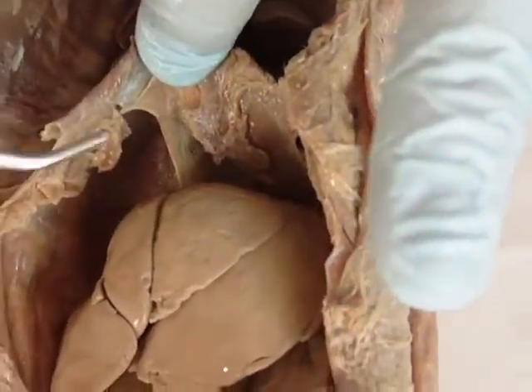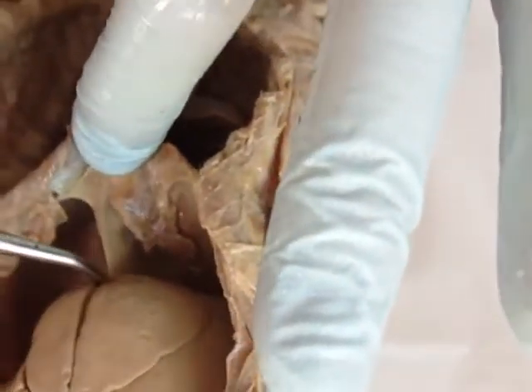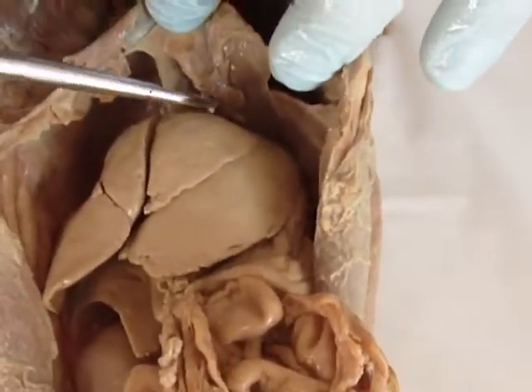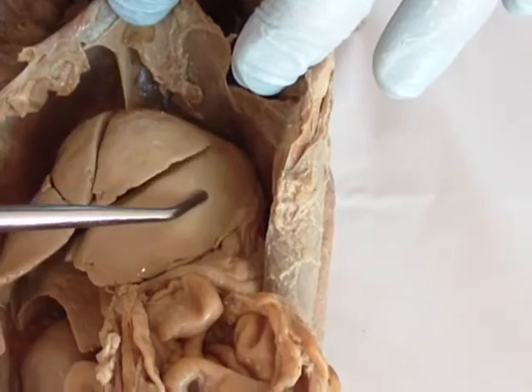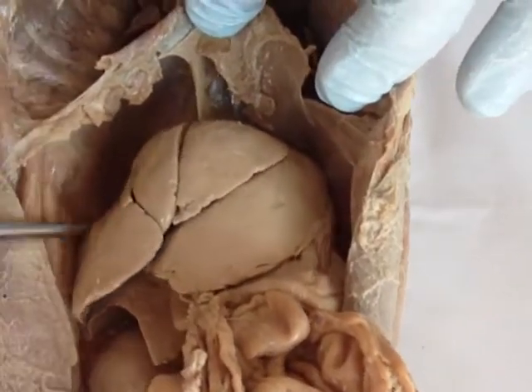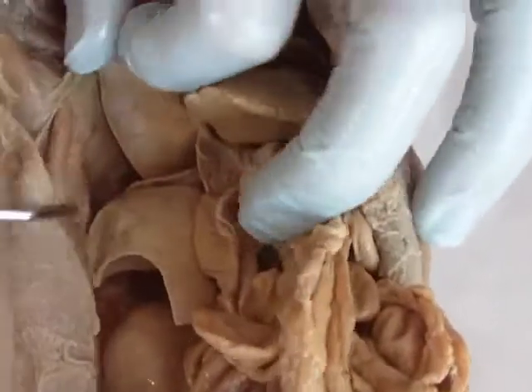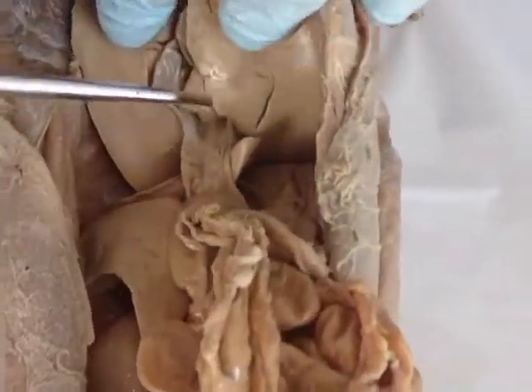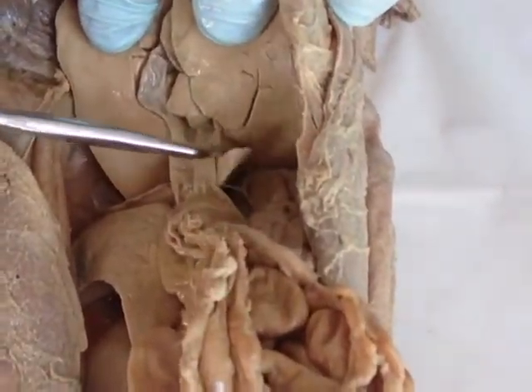When you lift up your diaphragm, you have this falciform ligament that separates the two medial lobes of the liver. This is your left medial lobe, left lateral lobe, and right medial lobe. Lift that up — both of these are your right lateral lobe. Number five here is your caudate lobe.